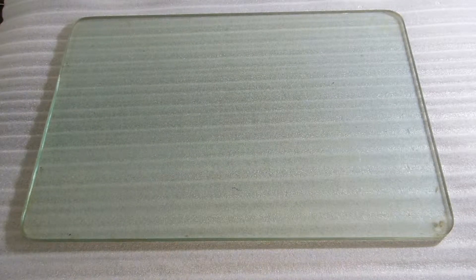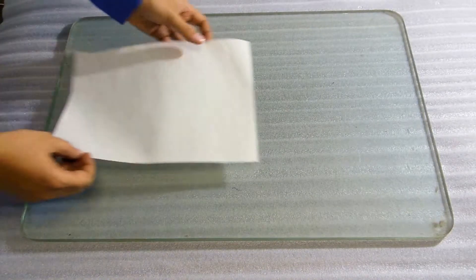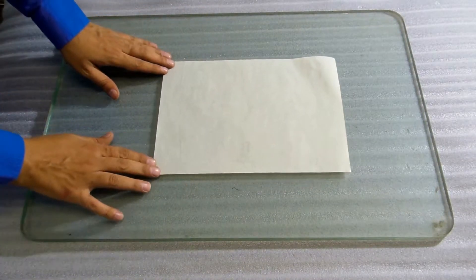The following clip describes how you can make a sample for a tape that has a width of more than 1 inch. Place a sheet of silicone release paper. Apply pieces of adhesive tape to hold the paper in place.